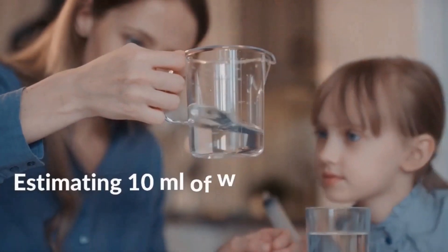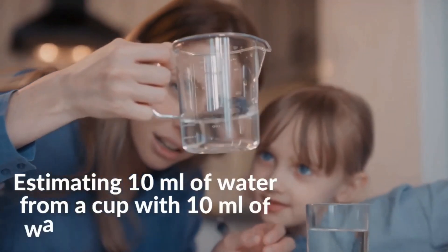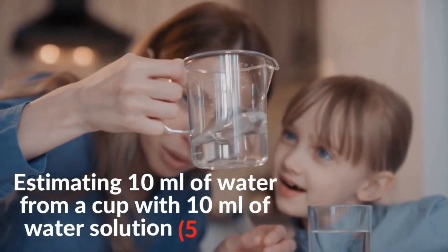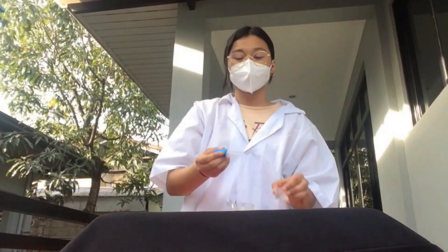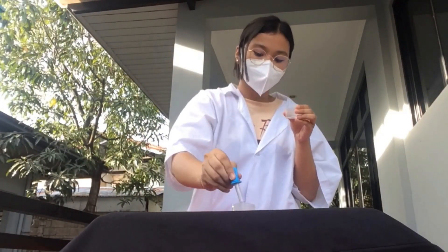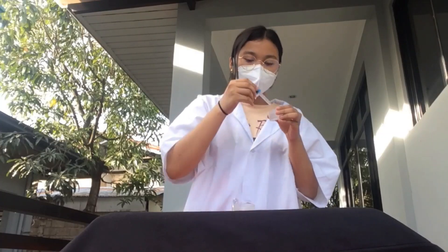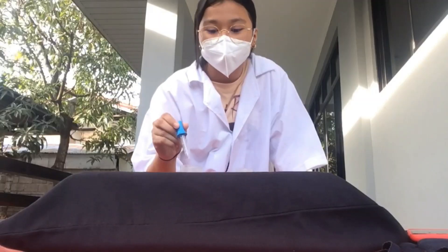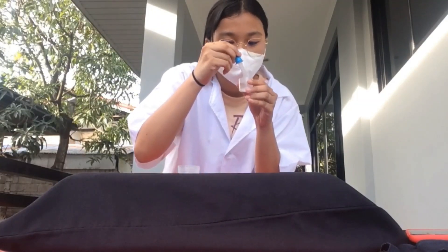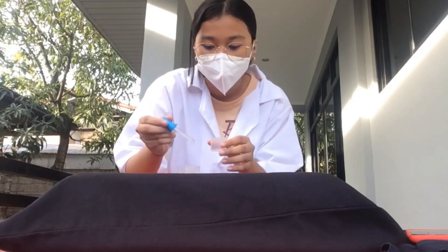The last practice of this process is estimating 10 mL of water from a cup with 10 mL of water solution, done for 5 times. We have 2 cups — one with 10 mL of water solution and one that is empty — and we use a medicine dropper to transfer the liquid.